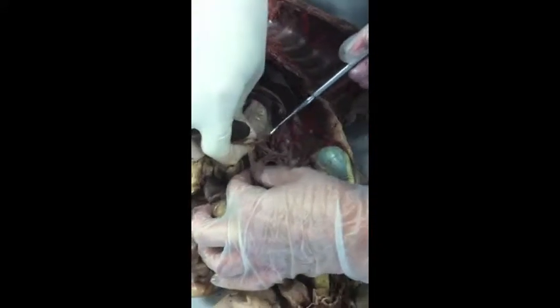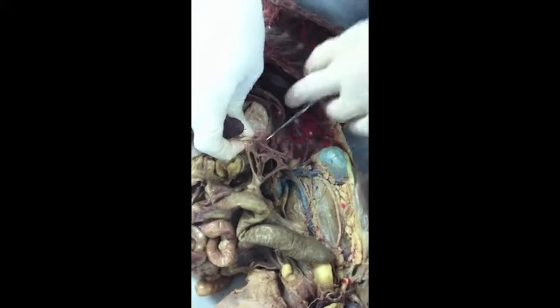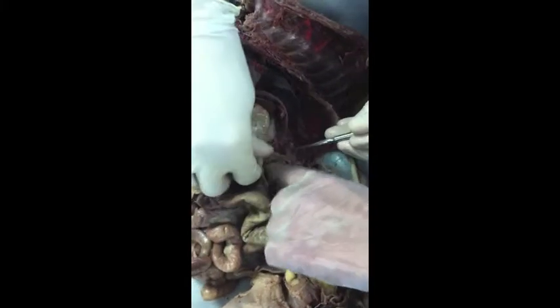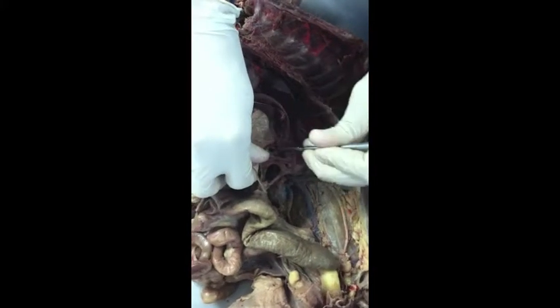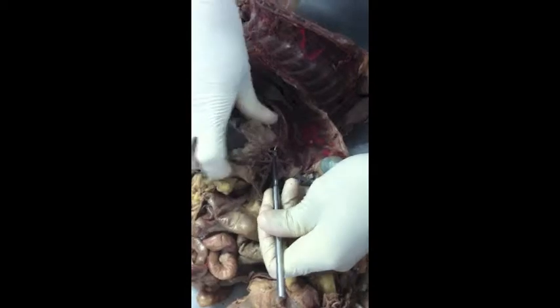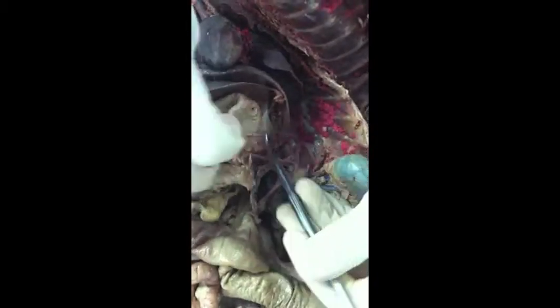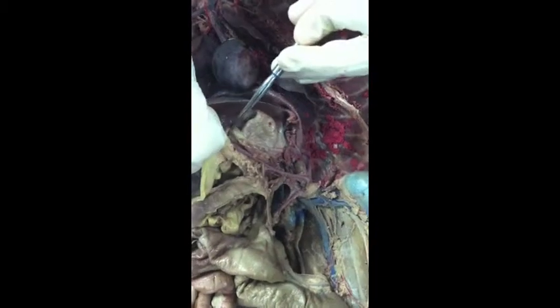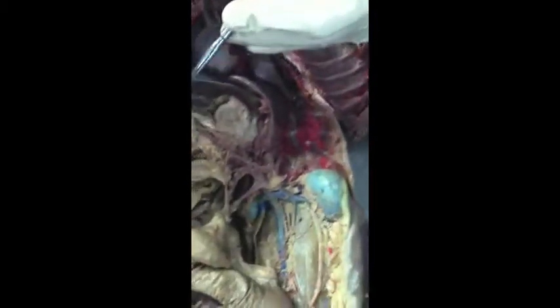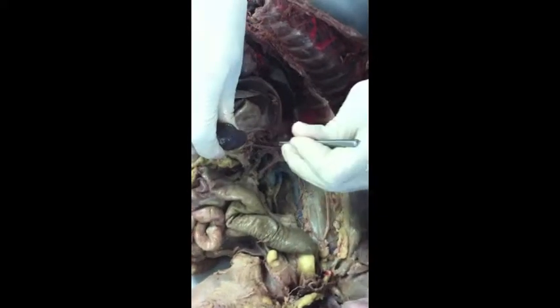You should just tell me what they are, in order. Hepatic, gastric, and splenic, right? So we have the hepatic, the one that's going to the liver. That's this one. Gastrics, whatever ones are touching your stomach, that's these guys. And splenic, the one going up into the spleen. Hepatic, gastric, splenic.